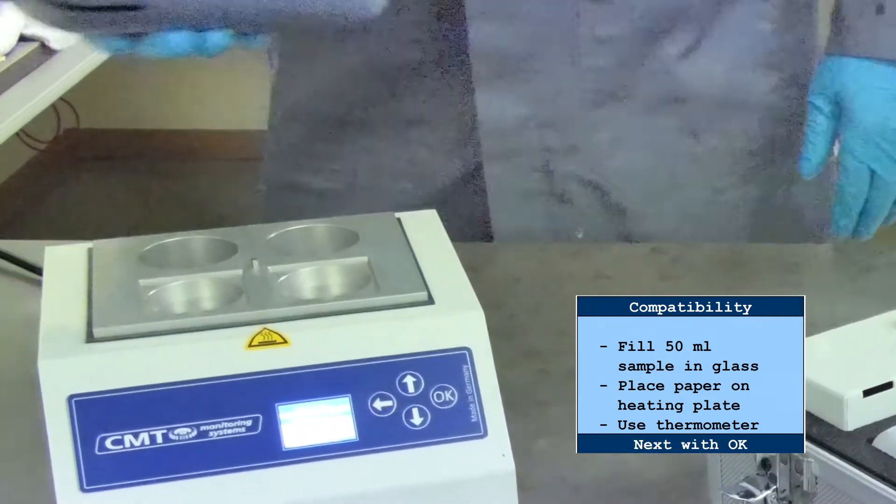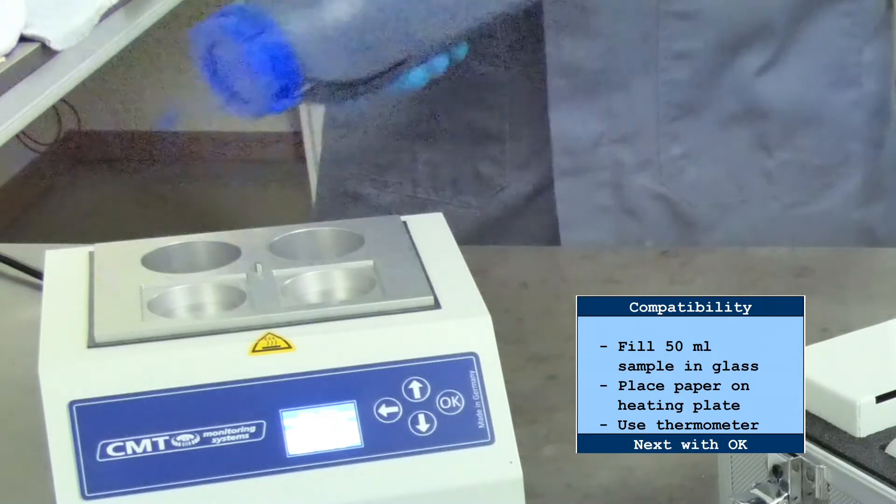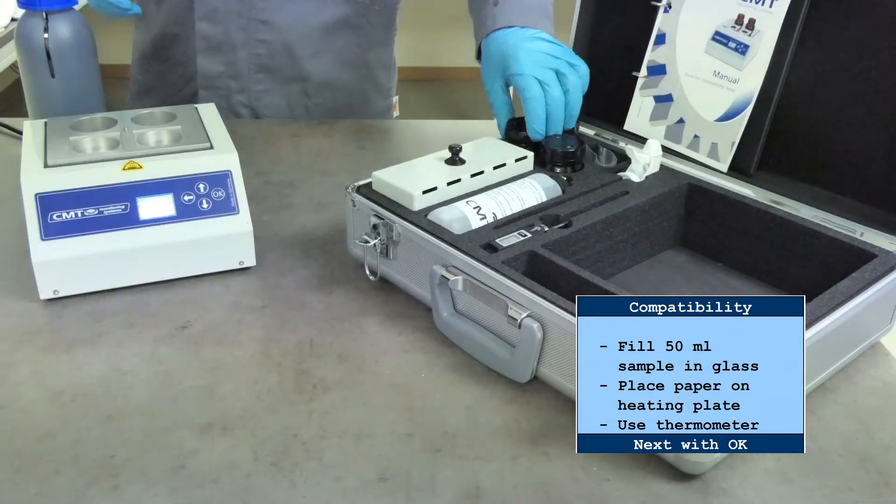Make sure to shake and mix fuel samples thoroughly before testing. For older samples, mechanical shaking and mixing, including heating, is recommended.